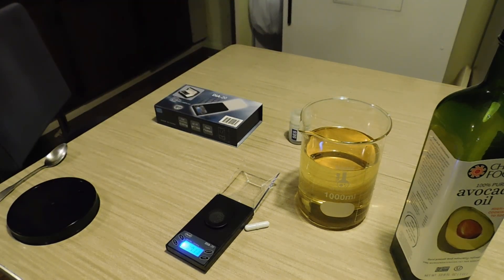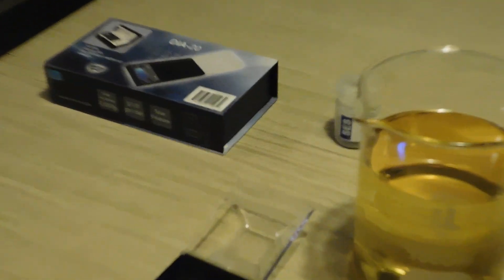Alright, so let's... Why won't this thing focus? Doesn't make any sense. There we go. Oh, now it turned off. Oh well. Anyway, okay, let's pretend the scale said 700 milligrams.